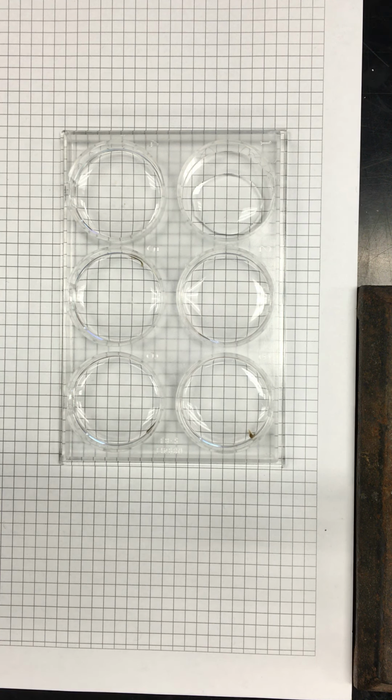Sorry about that. It's okay. That happens all the time. Got my head in the planarian, wasn't it? Yeah, you can go with 10 millimolar. That's just fine. Okay.